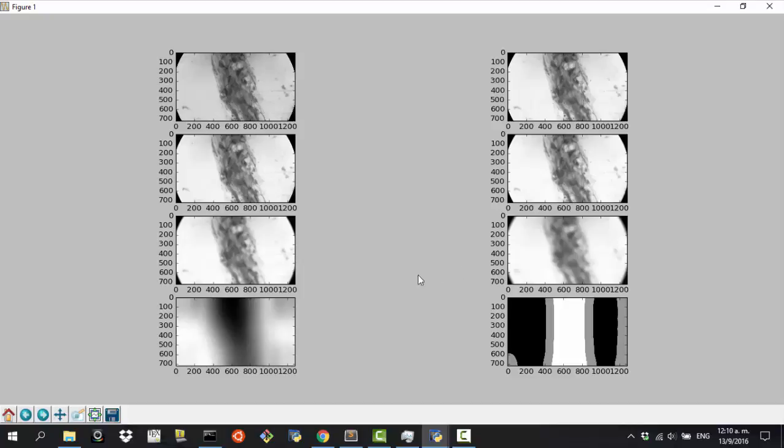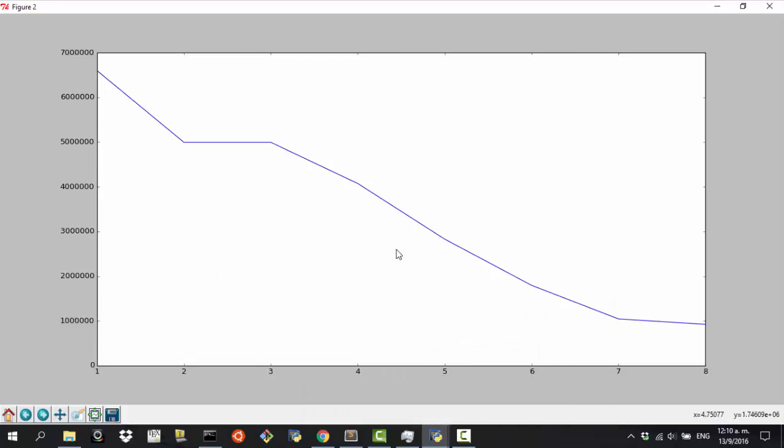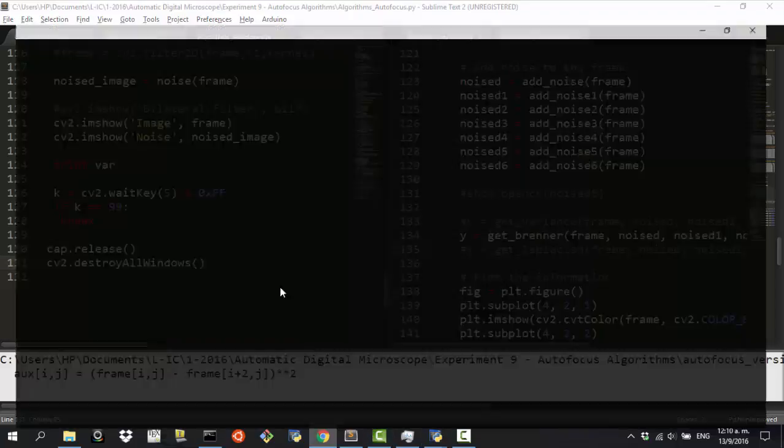As you can see, these are the images that I have shown you before, and this is the result that we have. So the focused image still has a very high value, while the other not so focused images and the not focused image at all has a very low value. What I don't like about this is the fact that it takes a lot of time and it computes very high values. I know that I can still divide this, but the algorithm just takes too much time. Actually, I haven't seen the complexity of the algorithm.